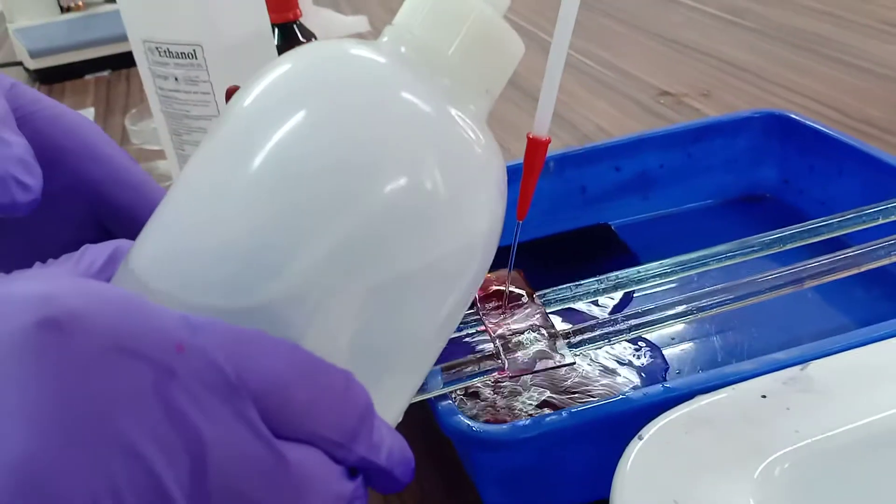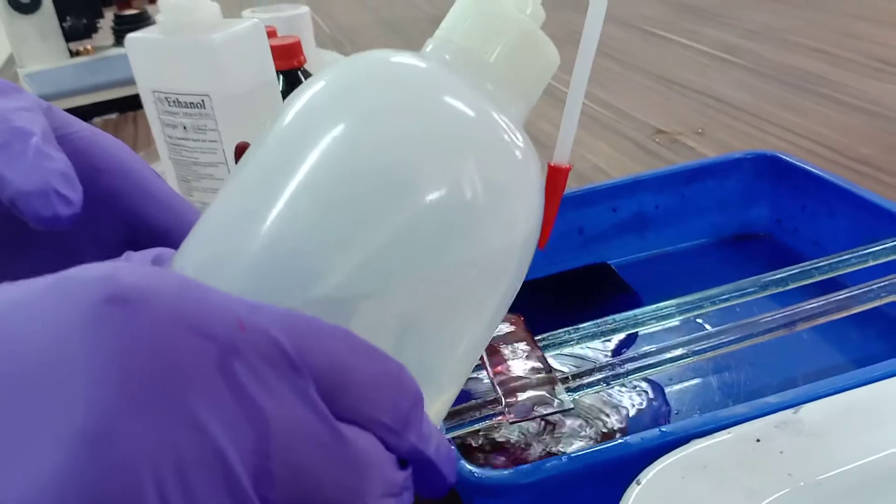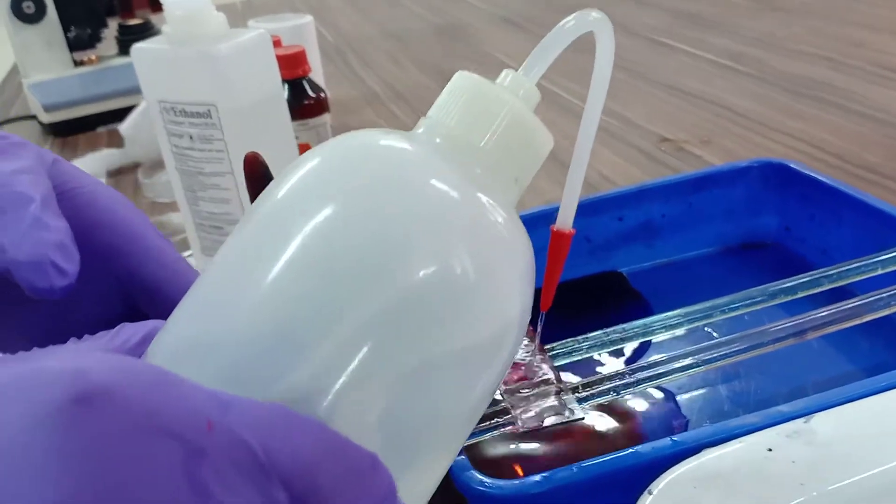After treatment with safranin solution, that is the counter stain, you have to clean with simple tap water.